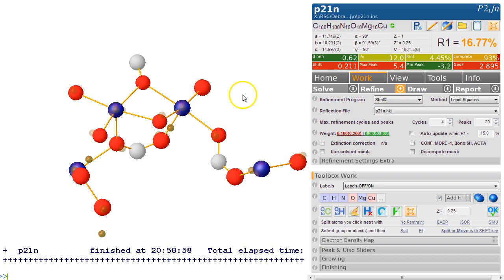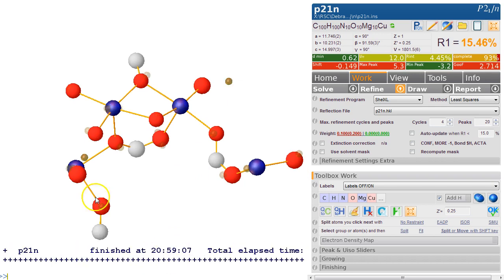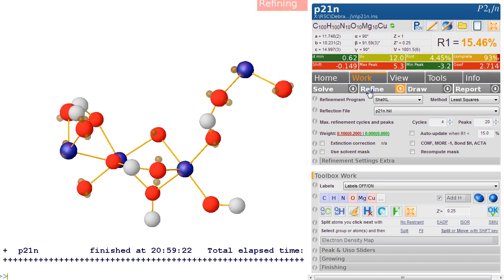And instead of hitting refine, you can also just type refine. So let's make this a carbon here. So name C, Ctrl R, refines without doing anything more. And now that's all coming together. There's a carbon here. Oops. And that's almost certainly another carbon. And the R factor is now dropping nicely. We refine again.